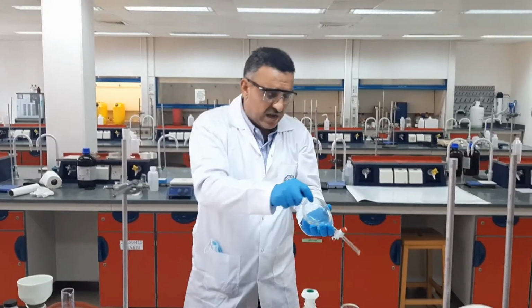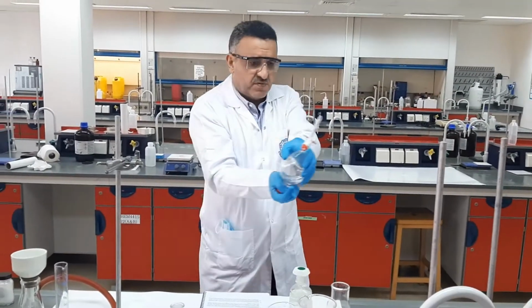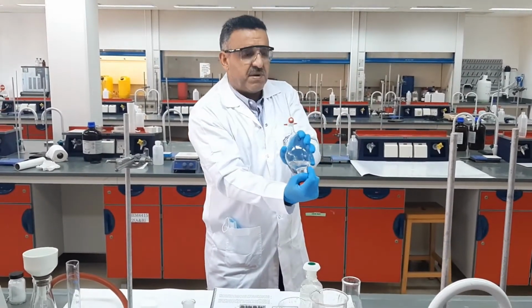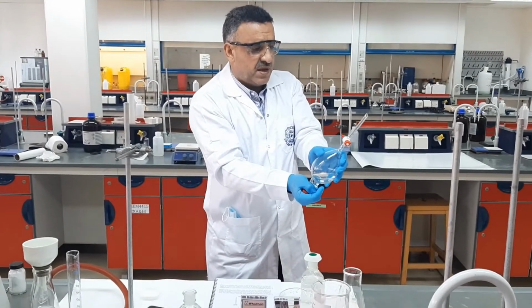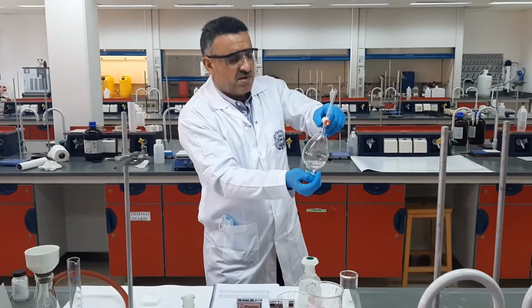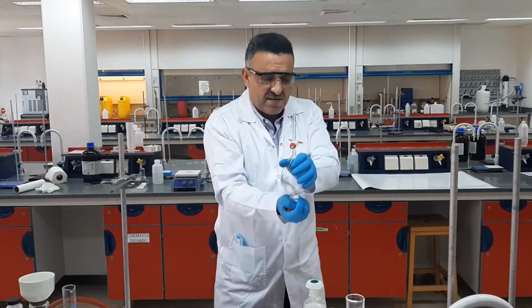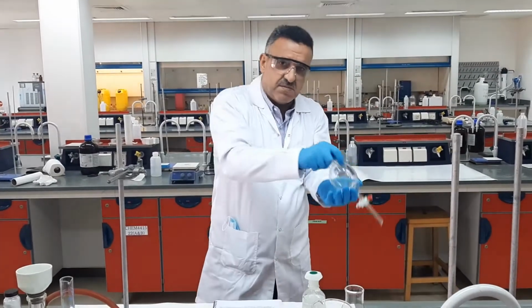Again, I should be careful not to point this into the face of others, and not my face even, just to be a bit far away from myself, and make sure that there are no vapors inside. At the same time, I have done the extraction more effectively.